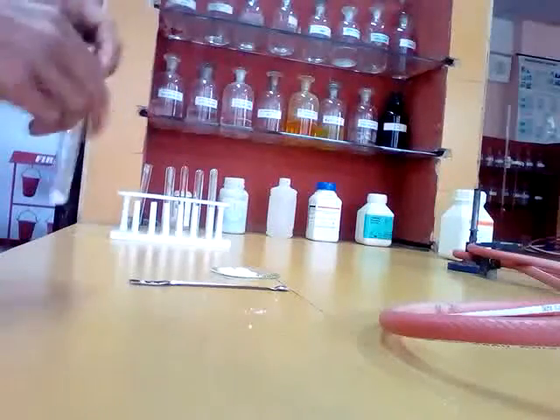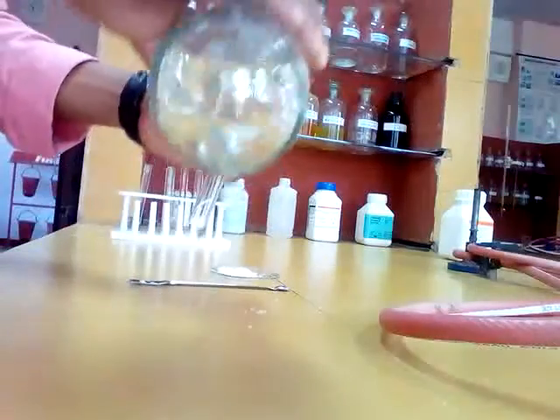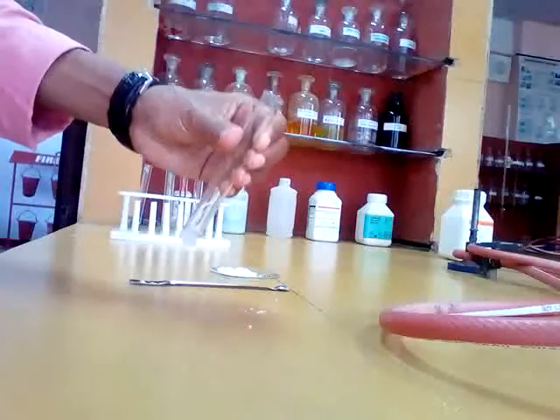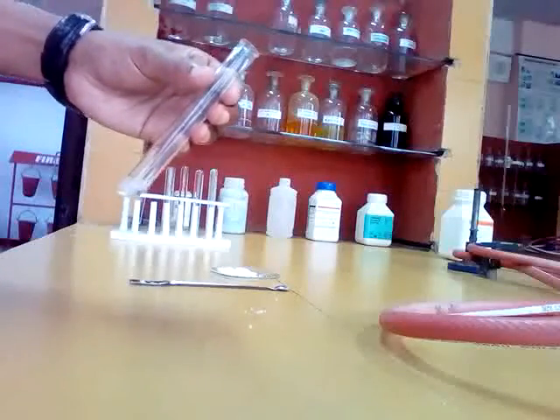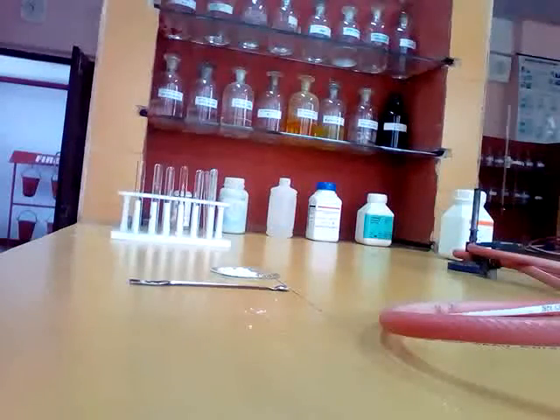Again you take dry salt in a dry test tube, then you put concentrated sulfuric acid and you observe. Now you observe no gases coming out from here, no pungent fumes, no colored fumes, so all the radicals are again absent. Chloride, bromide, iodide and nitrate are absent. Our dry test for acid radical is completed and we get no observation in the concentrated sulfuric acid test and also in the dilute sulfuric acid test.